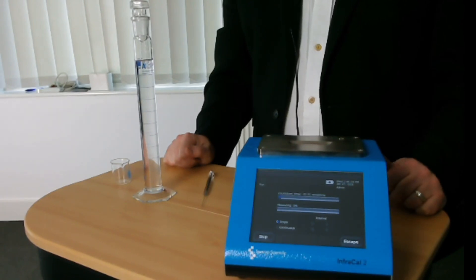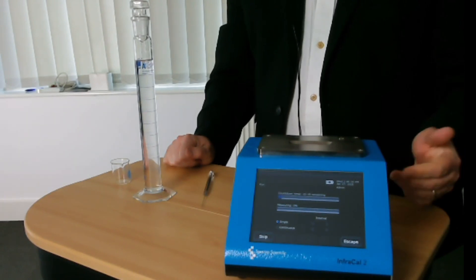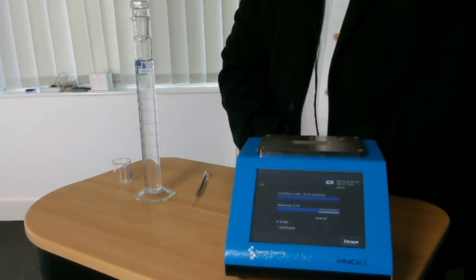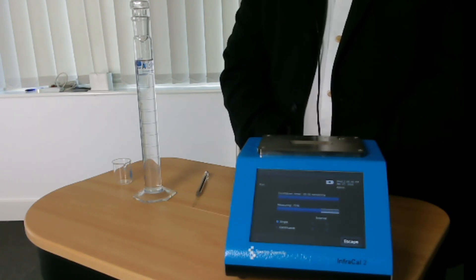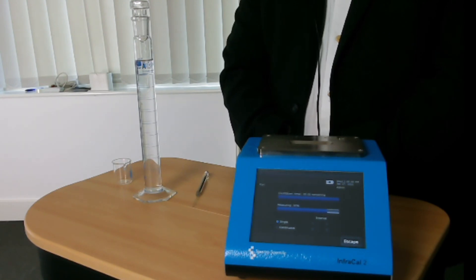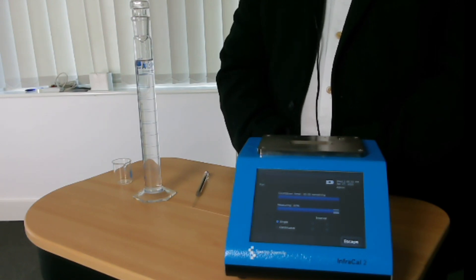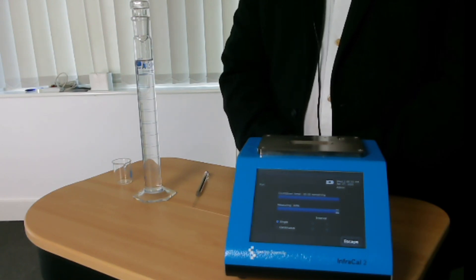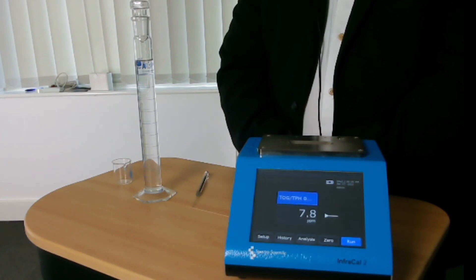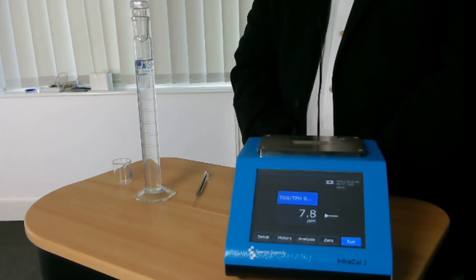After about a four or five minute wait, the instrument will display the result. The evaporation part of the process is finished, and now the analyser is quantifying how much fat, oil and grease is in the sample, and in a moment this will be displayed on the screen. There we go — 7.8 ppm in my sample here.